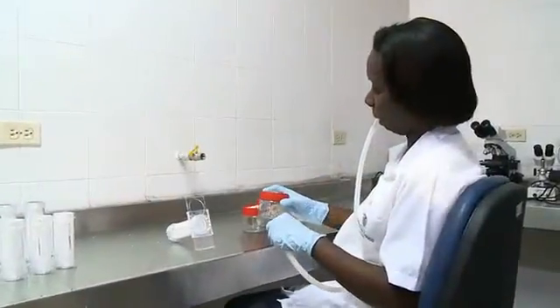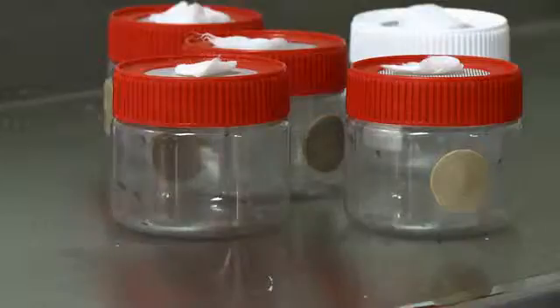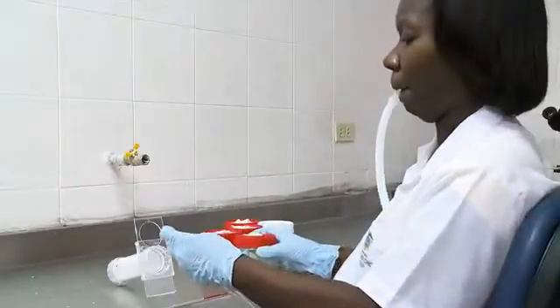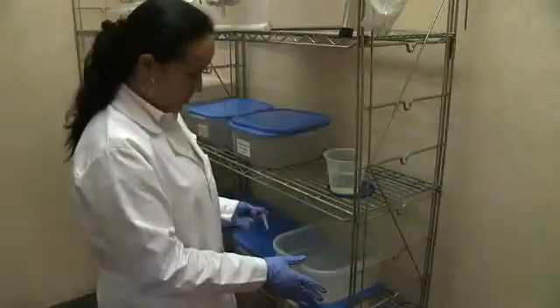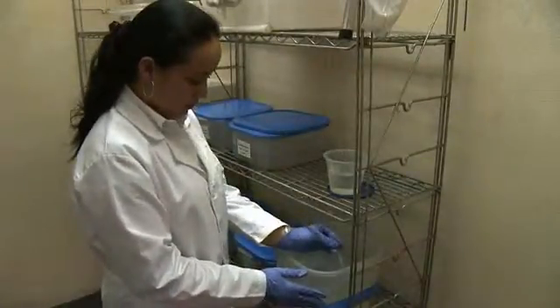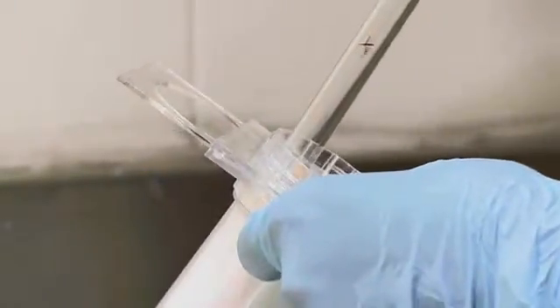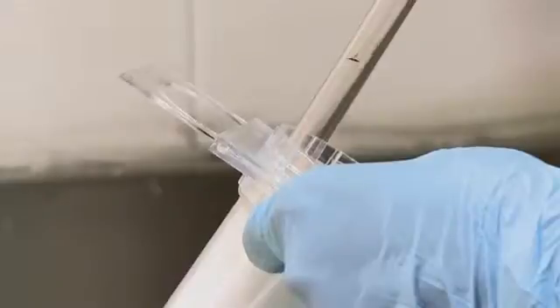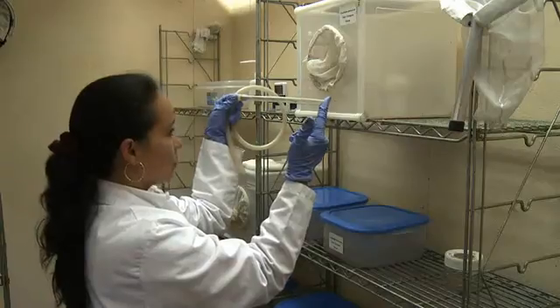To do this, follow the standardized protocol for susceptibility evaluations, which is to raise field-caught larvae to adults. To learn more about this, watch the video about susceptibility testing. Where a field-caught mosquito colony is determined to be fully susceptible, then members of the same sample colony raised in the insectary may be used. Where test numbers are not enough, the insectary colony could be raised through the next generation to increase the number of mosquitoes available for the test.